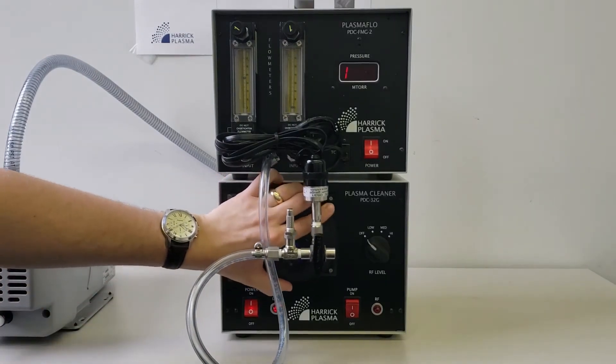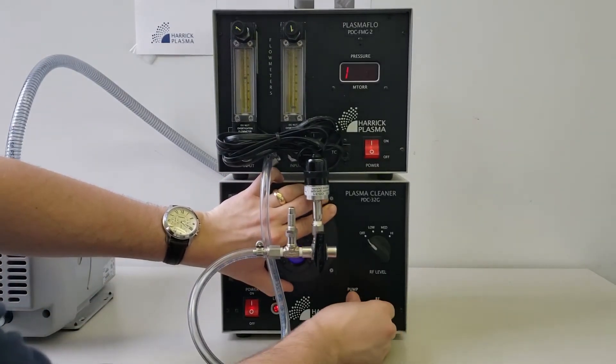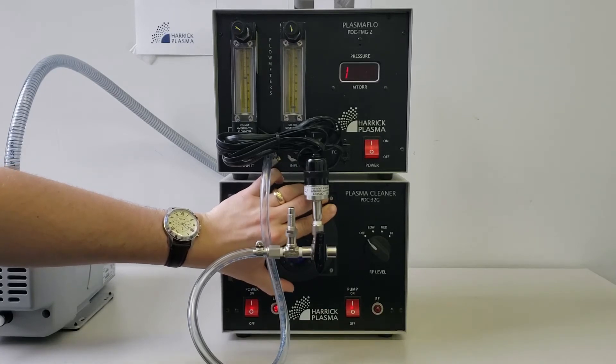Hold the door closed and turn on the vacuum pump to pump down the chamber. In some models, you may need to turn the vacuum pump on manually.